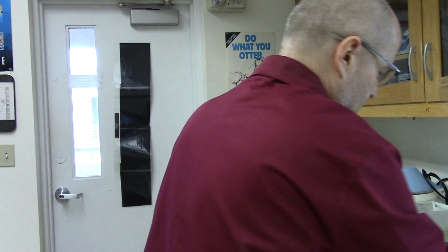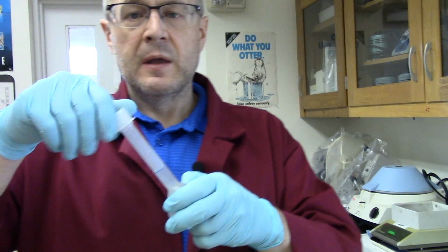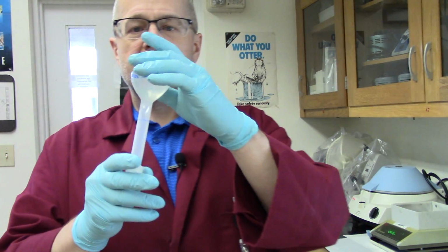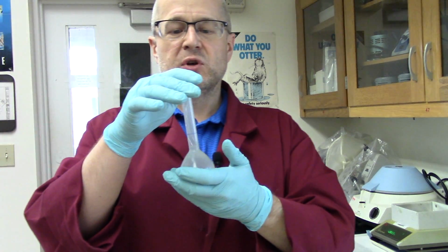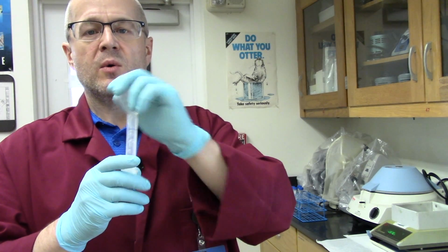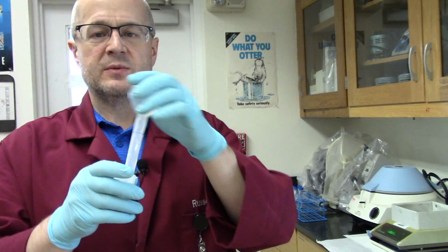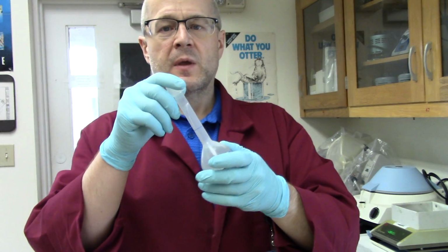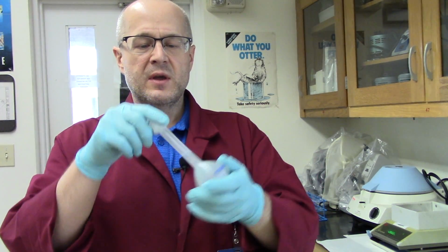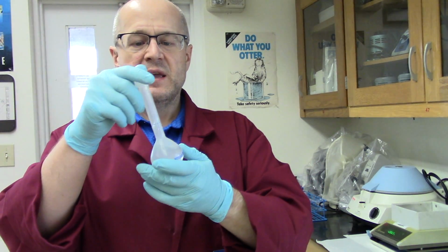Now, we put the cap on it. And now we have to shake this thing to get good homogeneous mixing. So you invert it, you shake it, you revert it, and repeat. You do this 10 times, guys. And I'm sure by the 5th time you'll wonder why you're doing it. And it's all about getting homogeneity in the solution. That's what it's all about. Homogeneity. Okay? That's about 6 times. We'll do this 4 more just to make sure we get good mixing of our vitamin C in our solution.